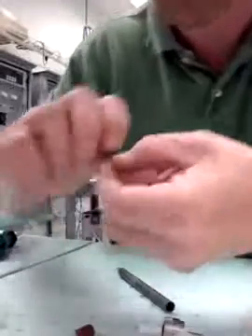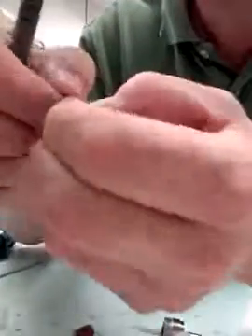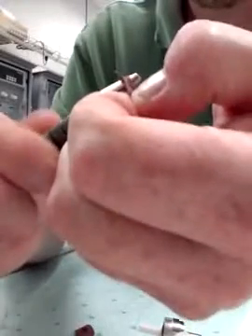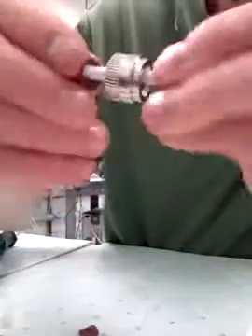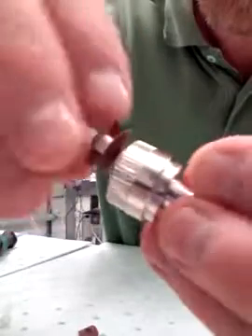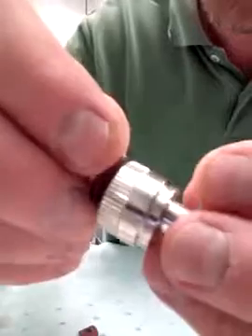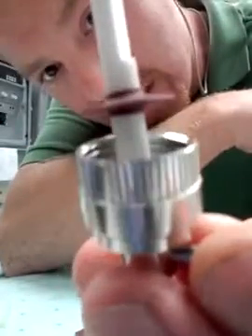I'm going to take another seal and ream this out as well. This will be a little bit easier because the flare portion of this seal is going to be pointing up — a little easier to push over the top of the shaft and a lot easier to slide over the indentation. It looks a little messy, but if you shove it down and pull up the collar piece a little bit, it will flatten out and should look just like that hi-hat piece.